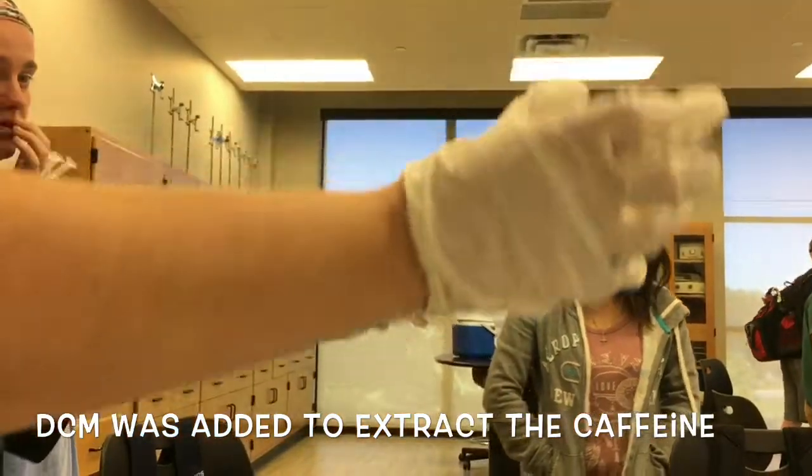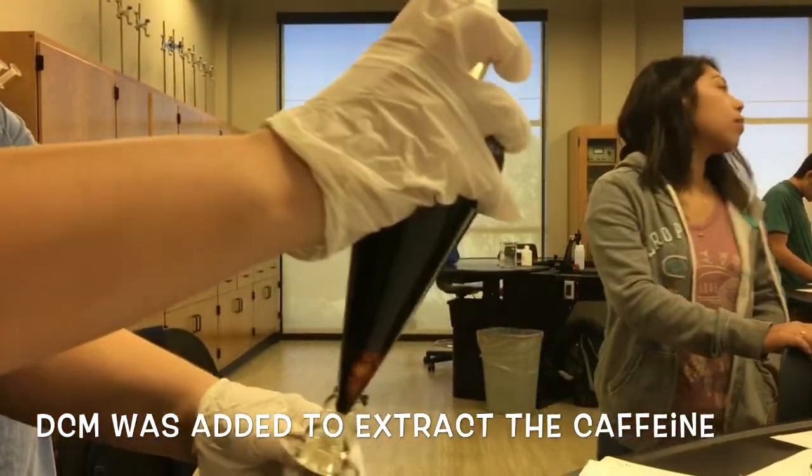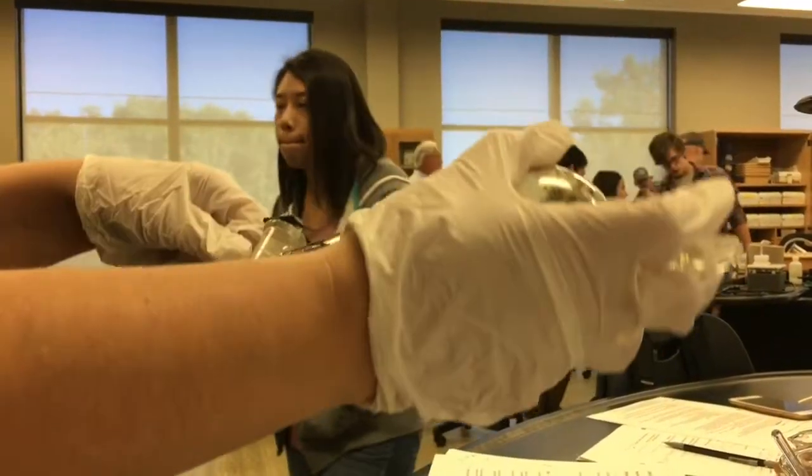I just want to shake it in circles. What did he say to do? Swish it. Because they said it would turn into emulsion. So we're just going to gently turn it up and down one more time.